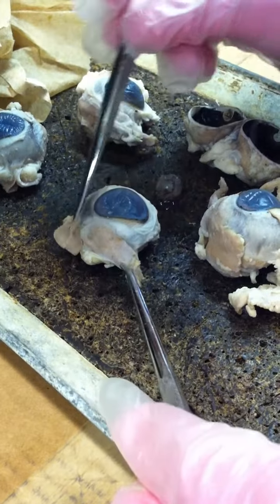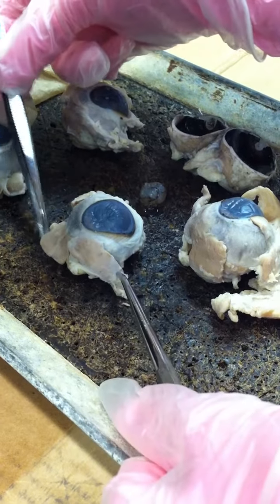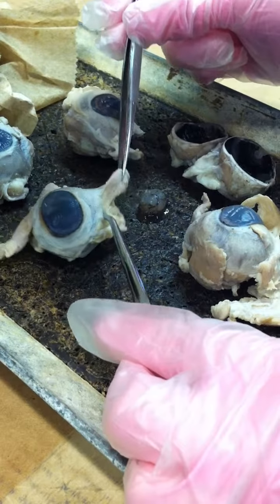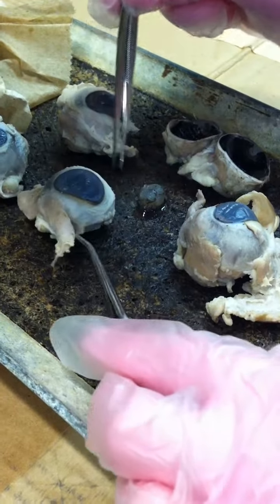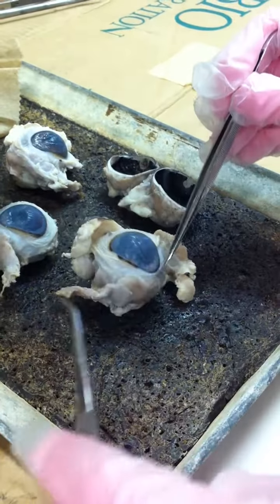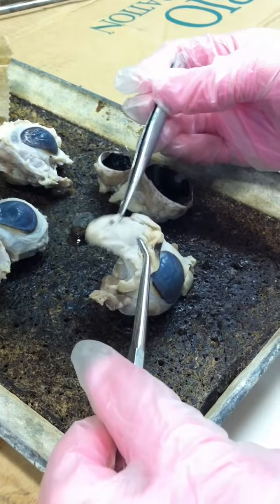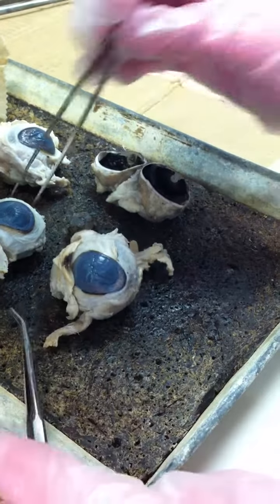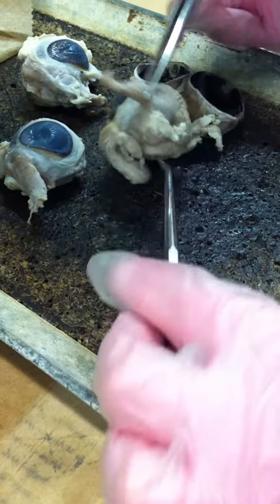So this is running from lateral to medial. So if this is the lateral side, the lateral rectus, superior rectus right here. The medial rectus is not on this eye, but it's on this eye, which is the opposite eye. But you see the nictitating membrane right here, and right next to it is the medial rectus. It also runs back, and then you have the superior rectus, and then underneath the oblique, you have the inferior rectus.